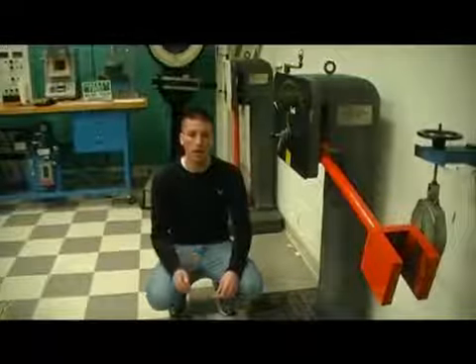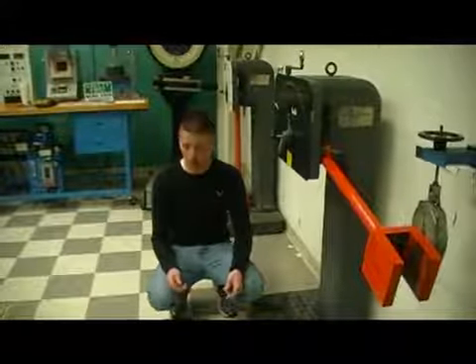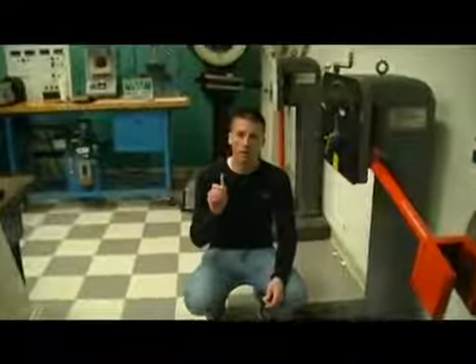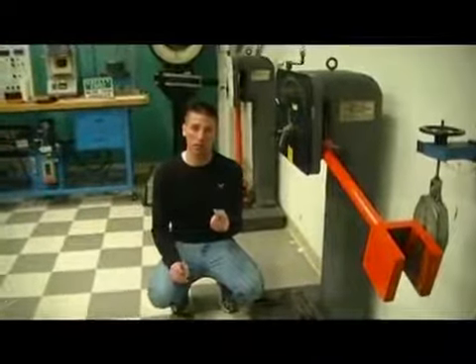Now that we've zeroed the test machine, we're ready to begin our first test on the Izod machine. First, we need the Izod test sample. These are the longer of the two samples, and this will be used, again, in both aluminum and steel specimens at the 3 different temperatures. We also need the jig. The jig, just like we had in the Charpy machine, will help us align the sample so it's struck at exactly the right point. This jig gets left in during the entire experiment and does not need to be removed.